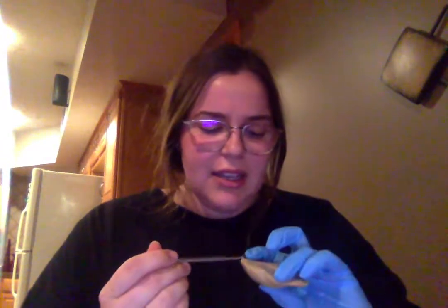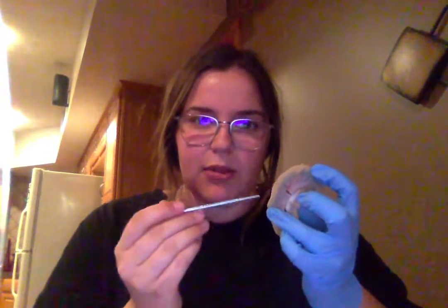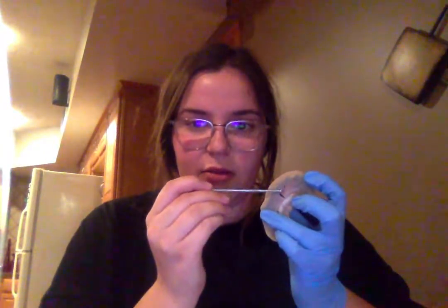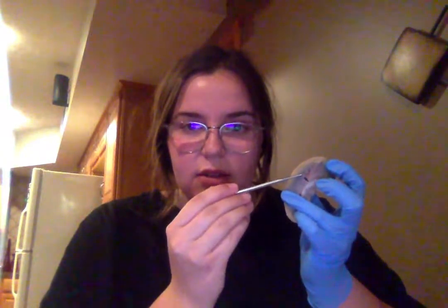Next, we have the renal pyramids, which were quite hard for me to see until I pulled back on this a little bit. Then you can see the striations, kind of like in the textbook pictures we were shown, that allow me to see where the renal pyramids are. So about right here. And then in between each of the renal pyramids, there is a renal column. So the structure right here.